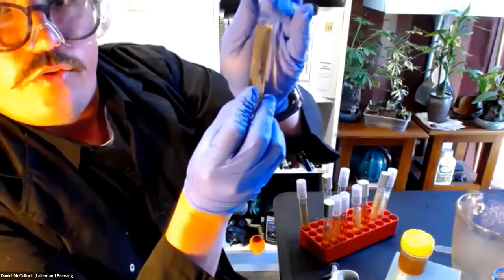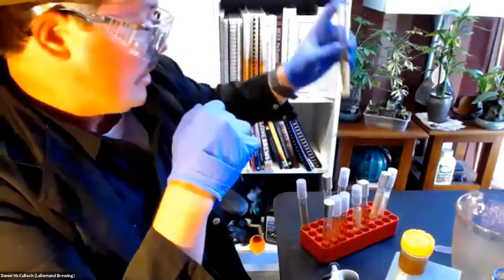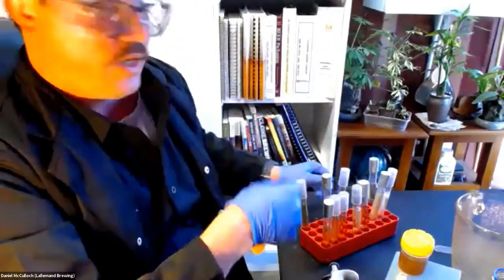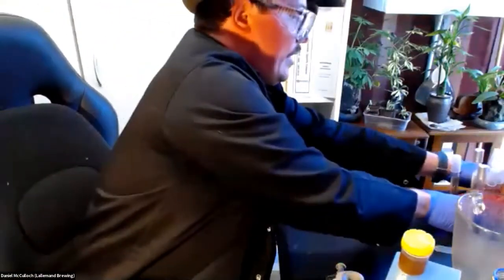Normally, you wouldn't put such a high concentration in. You would be diluting in some sterile water, and then inoculating into these tubes.